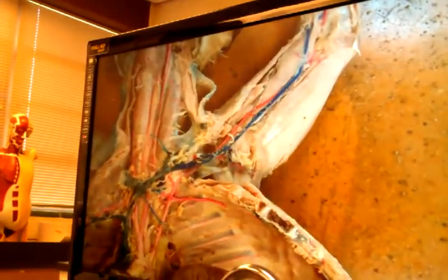Now watch brachial, Mr. Gilmore. I need you to focus in on this, because this is what I need to make sure I know. You'll notice brachial is the part that's in the arm, but then he goes through this little hole in a bone. This hole in the bone, Mr. Gilmore, that you're talking about is called supracondylar foramen. Supra means above. Condylar just means pertaining to the condyle. So the supracondylar foramen, Mr. Gilmore, if you pull on that, maybe I can see that move.